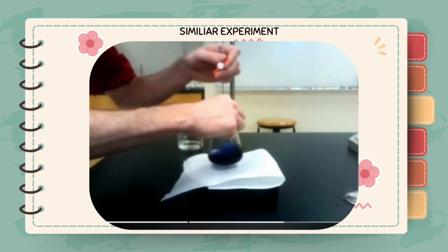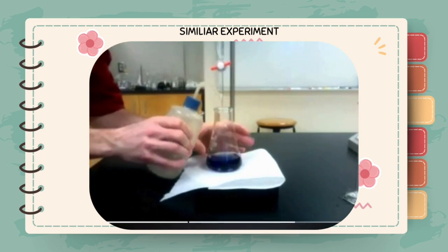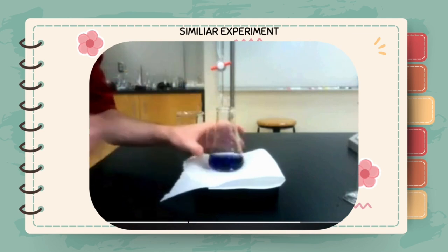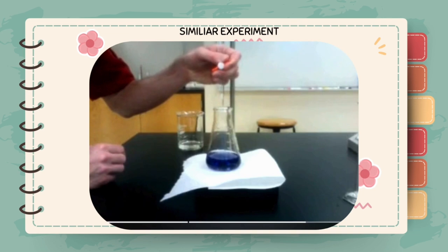This analysis is unique in the fact that we are using two reactions to quantify the amount of glucose in solution. The first reaction is between glucose and triiodide. Glucose is a reducing sugar and will lead to the reduction of triiodide. We have added an excess of triiodide to the solution. Therefore, when all the glucose is exhausted in the reaction, excess triiodide will remain.